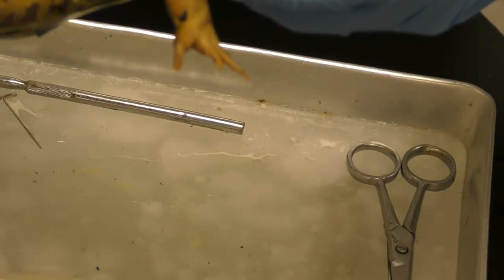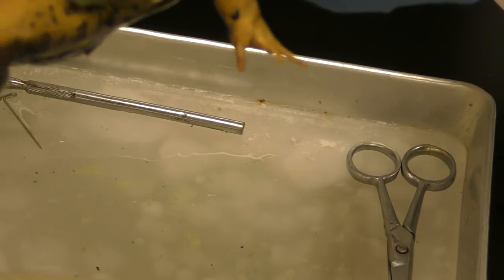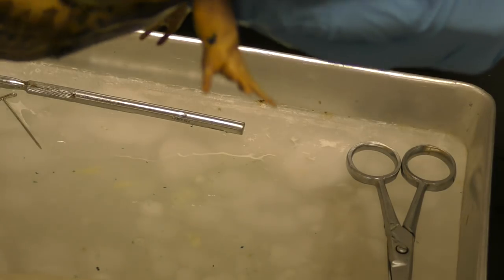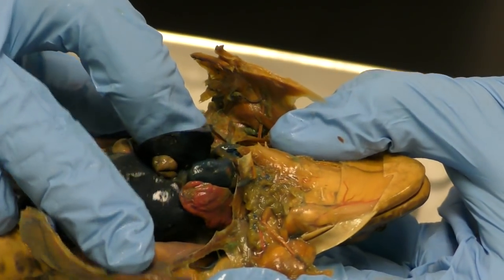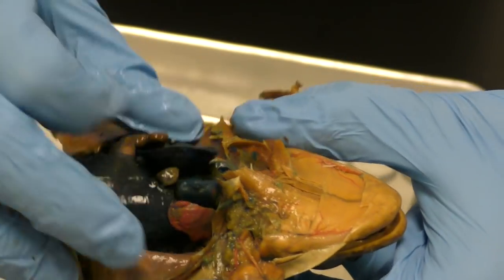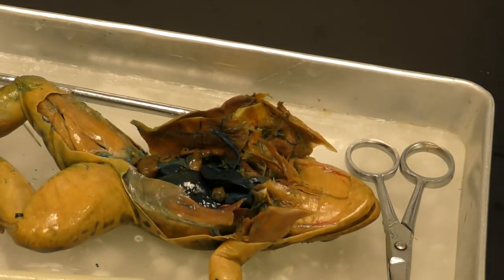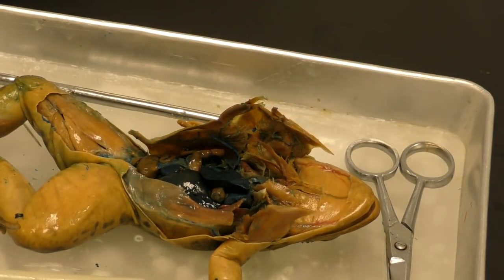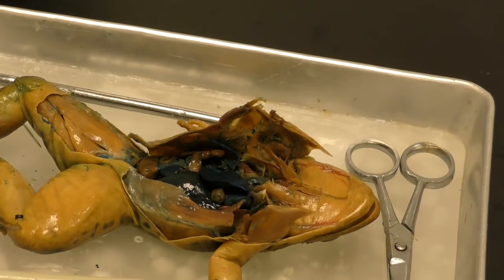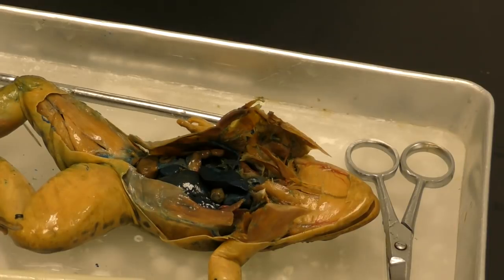Okay, and that just has to do with their level of breathing and how they breathe. Okay, so here we go. So these little pink parts on either side, one here and one there. Okay, that's it. So what system am I referring to when I'm talking about the lungs and getting oxygen in the body?